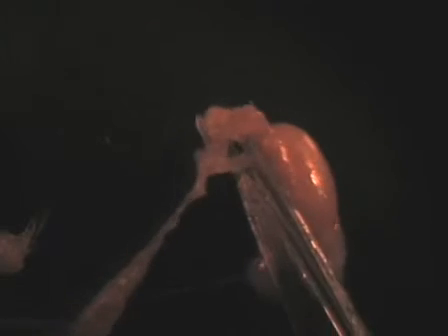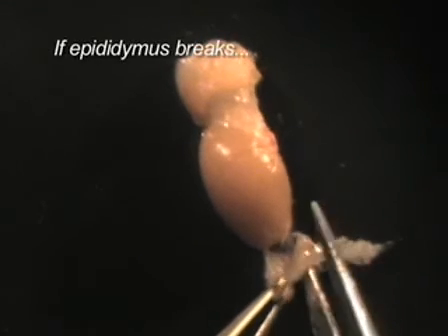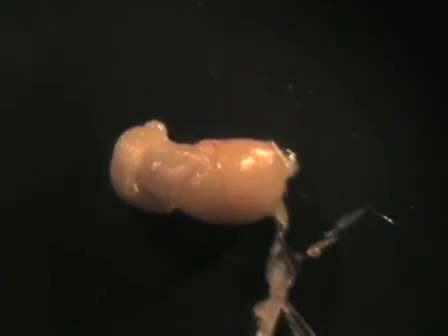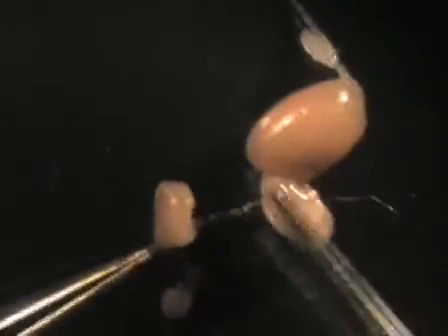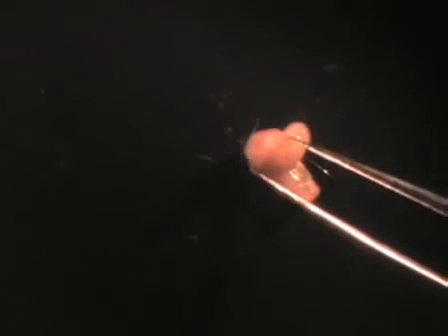Once this is done, it's very easy to slightly tear the epididymis away from the testis, isolating the entire epididymis. In this testis, the epididymis has actually broken along the side, so there are two different sections to isolate: one on the bottom which is still connected, and then the top portion, which I'm going to flip over to isolate in my left hand so I can cut with my right. Then cut the fat pad away, leaving the two different portions of the epididymis.